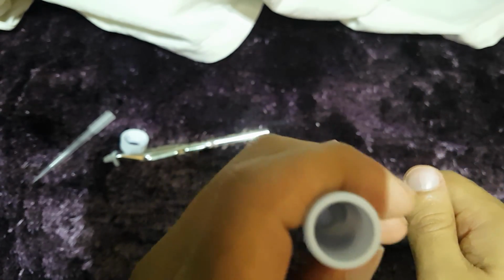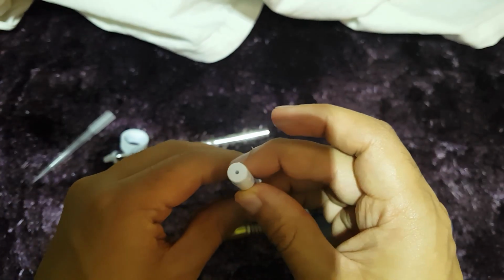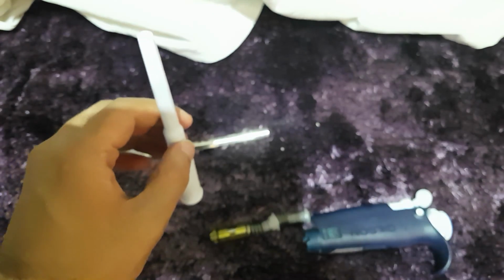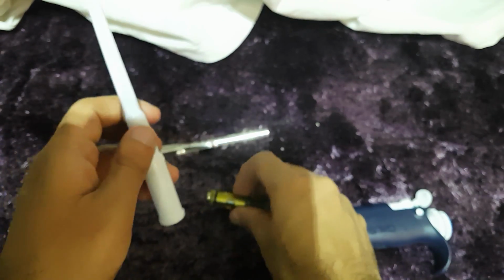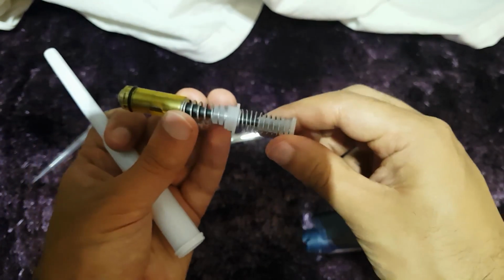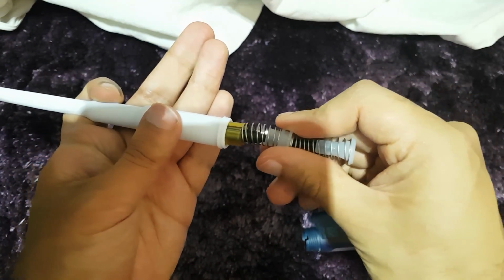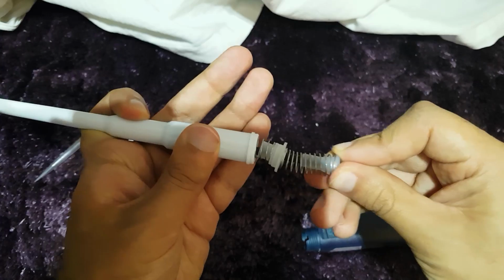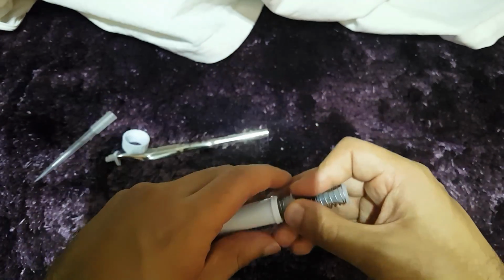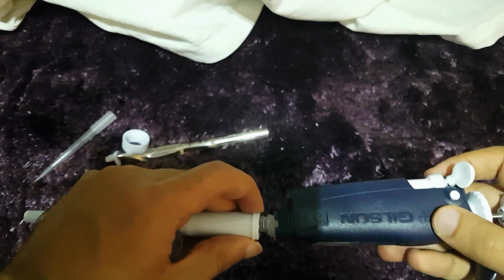you should be able to blow air through, so just give me one moment here. Let's just have a go. Okay, so upon testing, I can blow air straight through this, which meant that we just simply had a blockage in here. So now, we're going to put this back together again. So, here is the air chamber inside the pipette. What we're going to do is simply push this into there. Now, you just take the end of the pipette, you push it through here.